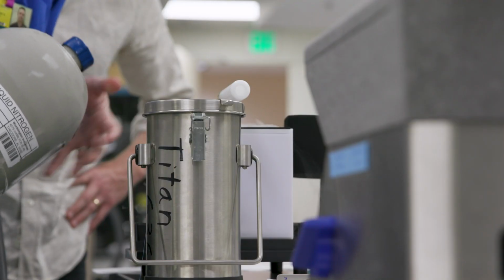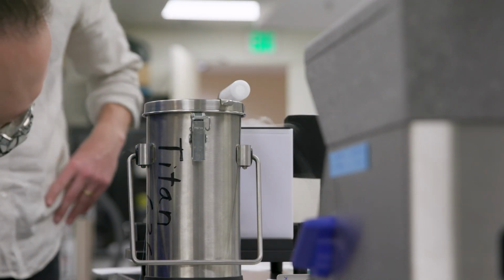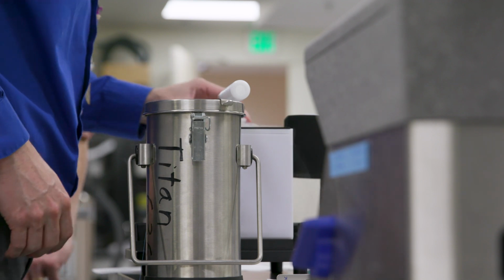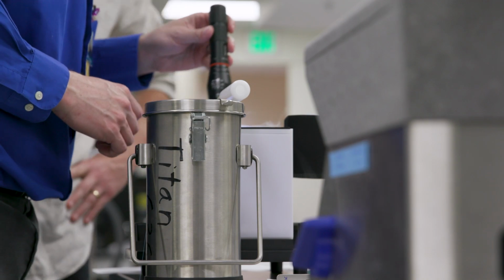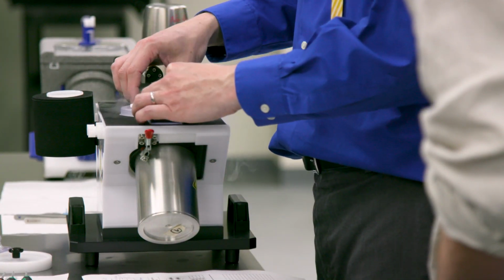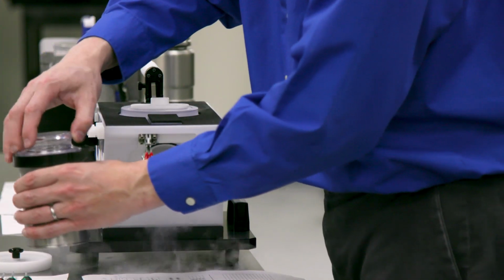The initial award that was made to us by the Beckman Foundation has really been pivotal for building cryo-electron microscopy and 21st century macromolecular imaging here at Hopkins. With the money that we received from the Beckman that went towards the acquisition of our first electron microscope, Titan Krios, we have since been able to leverage that into hiring an assistant professor doing very exciting work in neurobiology who works with cryo-electron microscopy. We've just made another hire at an assistant professor level on a person who's working on viral structures, also using electron microscopy.